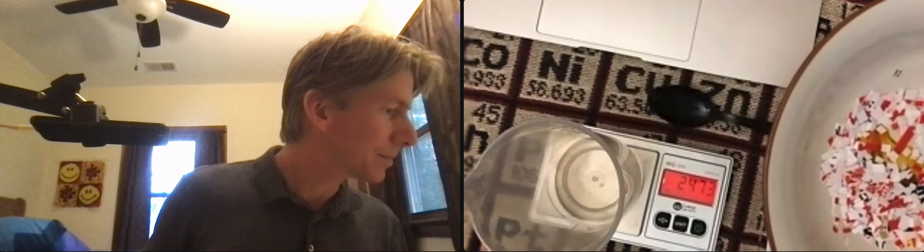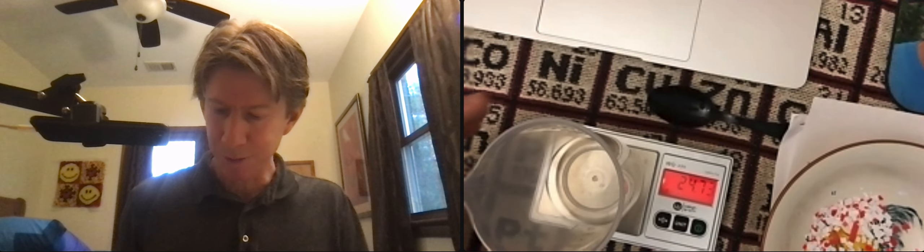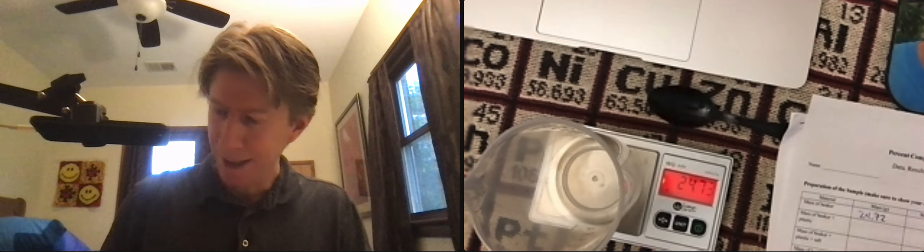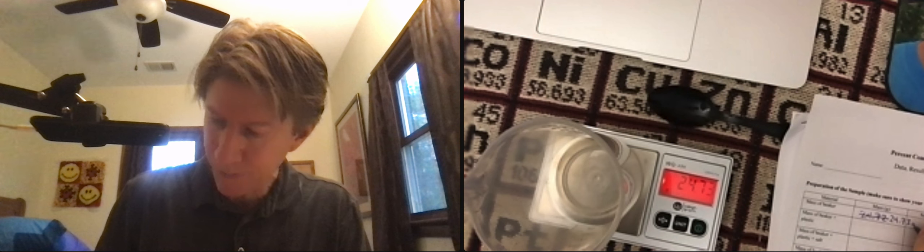And place the plastic pieces into the beaker and record the mass. I went to 24.73 but we know that it's only good to plus or minus 0.04 anyway.